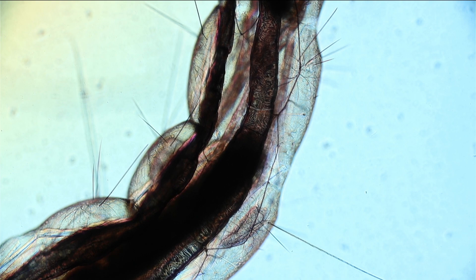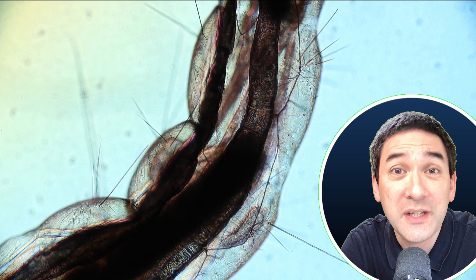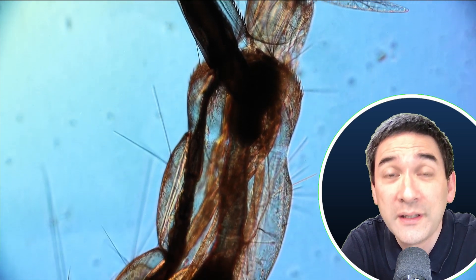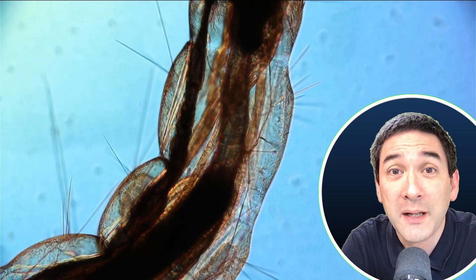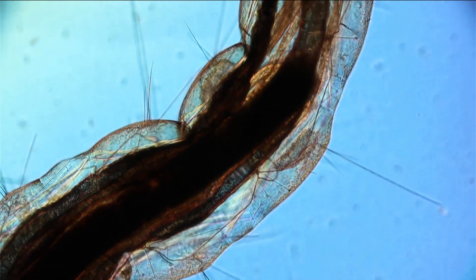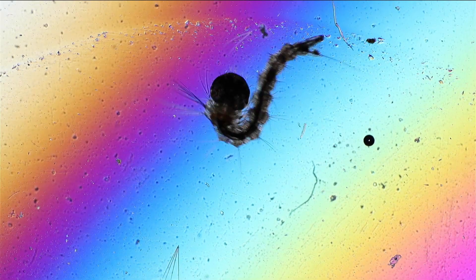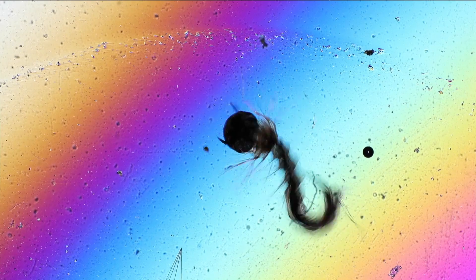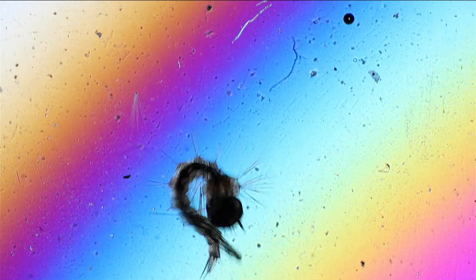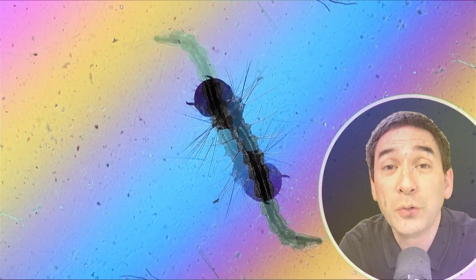Maybe fascinating would be a better word to use here. We can see that the mosquito is almost transparent — we are able to see the intestine on the inside. This organ in the back with a little air bubble is a breathing organ. The mosquito is actually able to breathe air by sticking out this organ into the air, dangling upside down in the water. We can still see some movements of the intestine. This is a slightly smaller larva, and you can see that its head is fairly large — it got stuck with its head between the cover glass and the slide, and it's able to wiggle around freely with the rest of the body. This is one of the reasons mosquito larvae are referred to as wigglers.